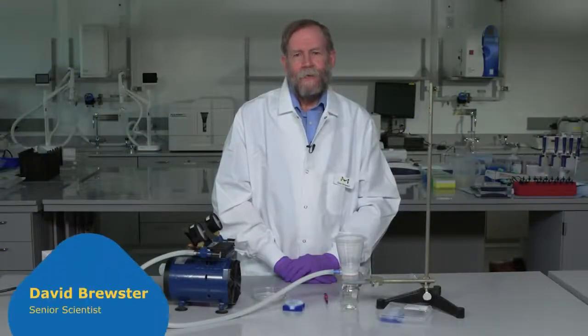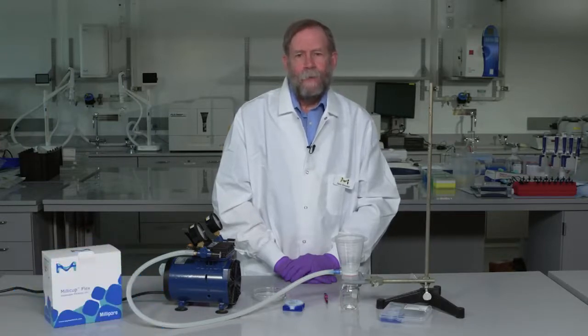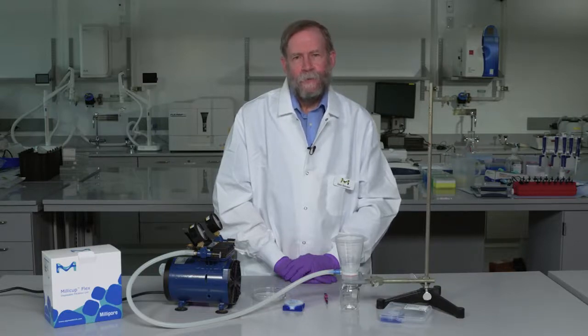Hello, my name is Dave Brewster and today I'm going to demonstrate the use of a Natrix Q membrane in a Millicupflex vacuum workflow single-use setup.